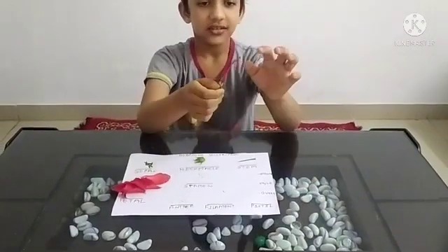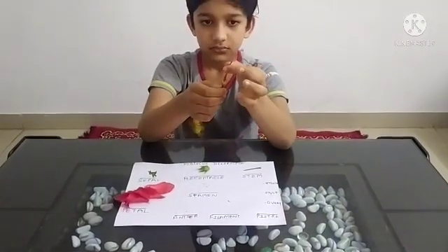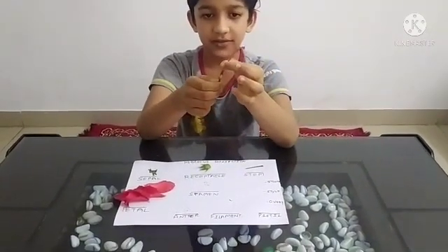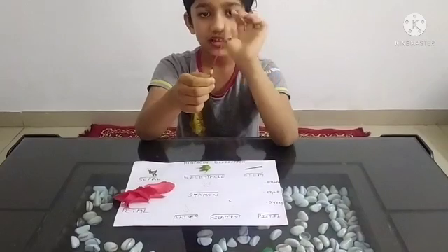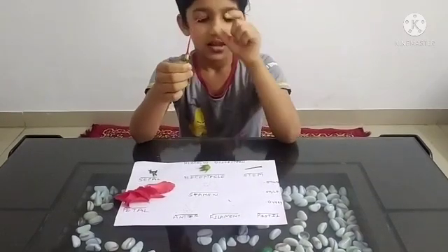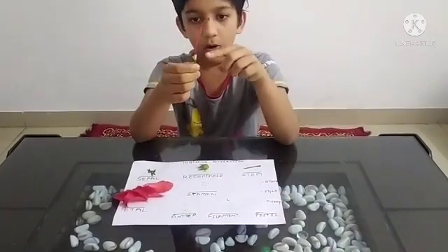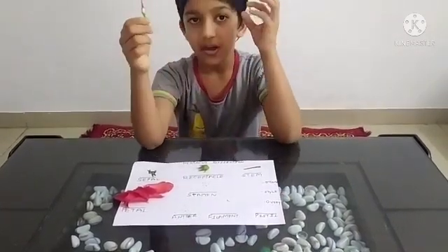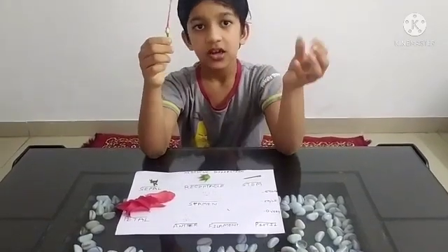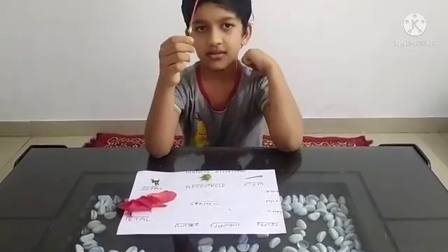This is the stigma. This thread-like structure which is holding the stigma to the ovary is the style. The ovary has the ovule, and the ovule, when combined with the pollen, becomes the seed.